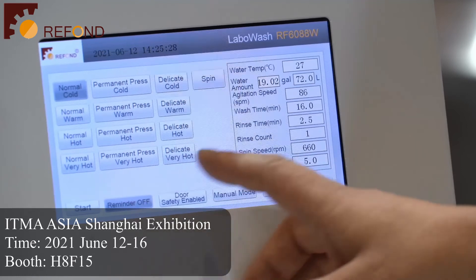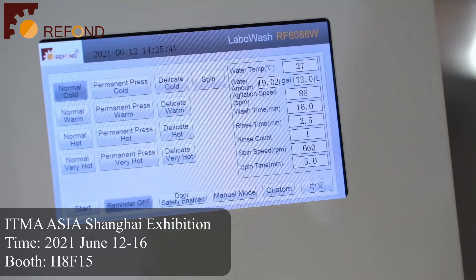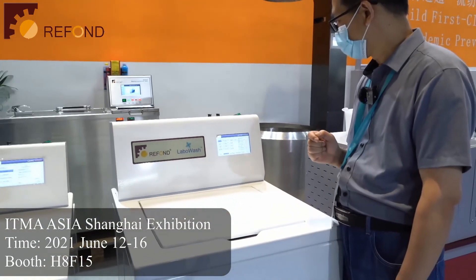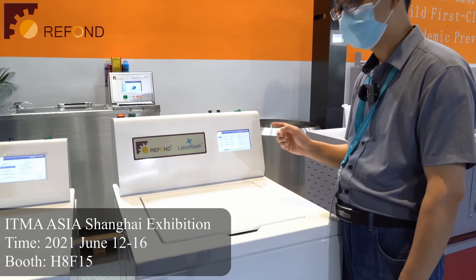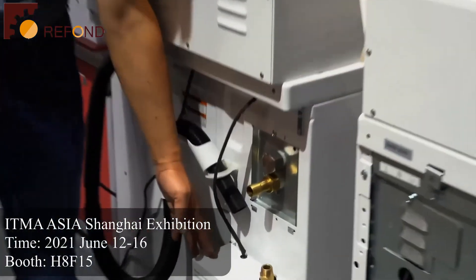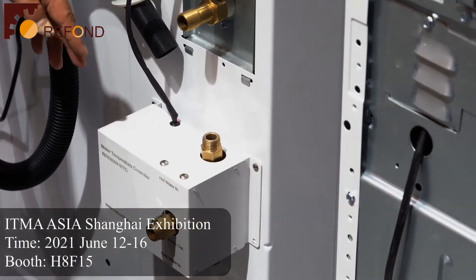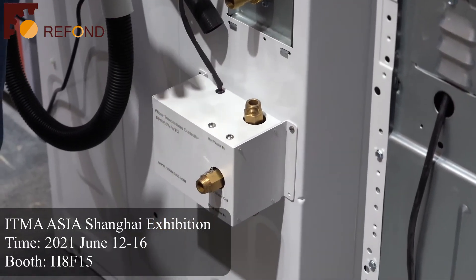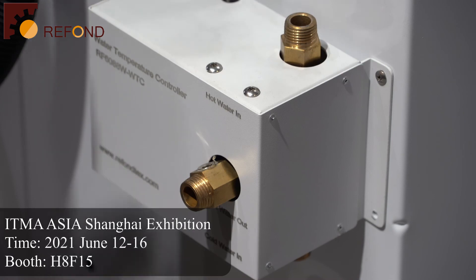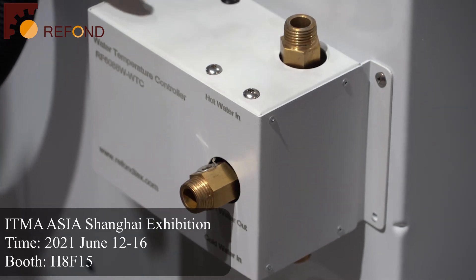That's all for our washing machine's touchscreen. In addition, let's talk about the water temperature control. Our machine has an additional device for water temperature control — let's go to the backside of the washing machine. You can see the water temperature control device. Inside this box is the automatic water mixing system. It can mix the input hot water and cold water inside this water temperature controller. After mixing, the water comes into the drum and the water temperature is well controlled.